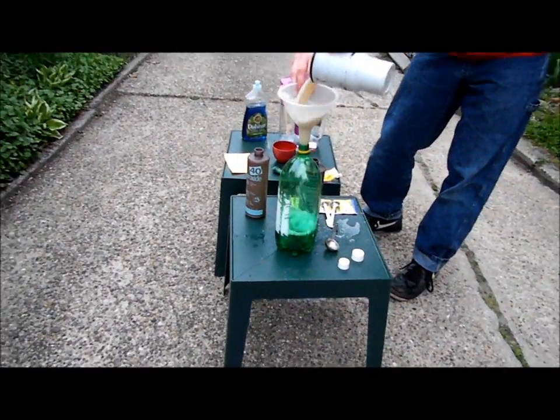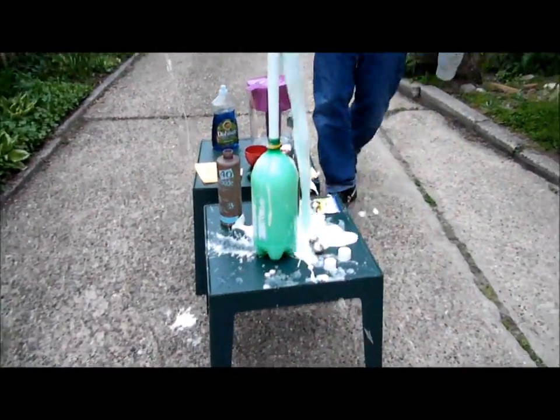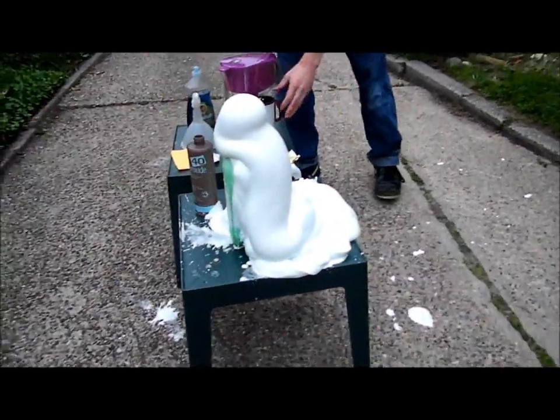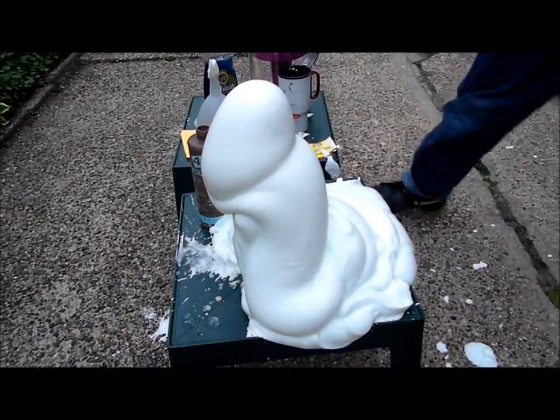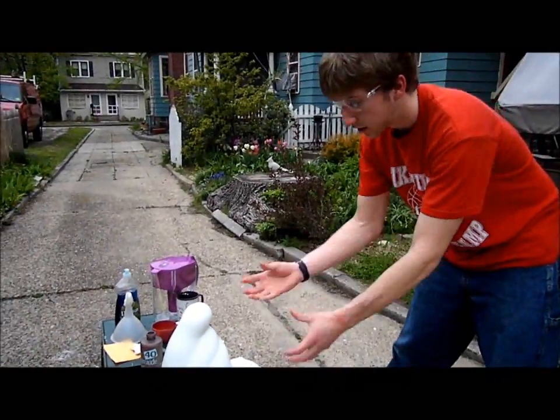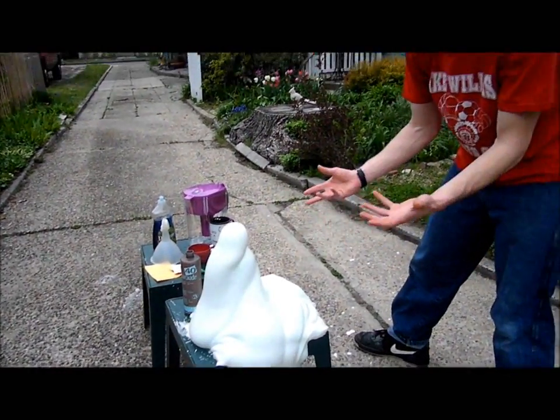Stand back. So you can see it's a pretty exciting reaction. I didn't even have enough time to get all the catalyst in there, but what's actually happening is the O2 gas is evolving, but it's getting trapped by all the soap bubbles. So that's why it takes this form, which actually kind of looks like toothpaste or something like that.